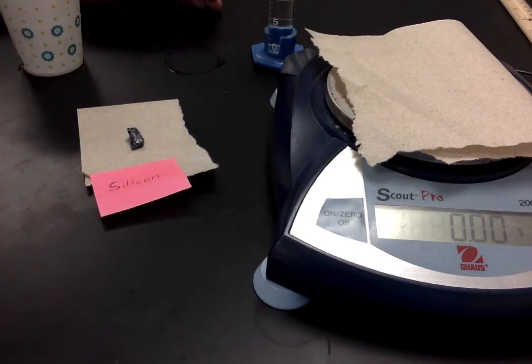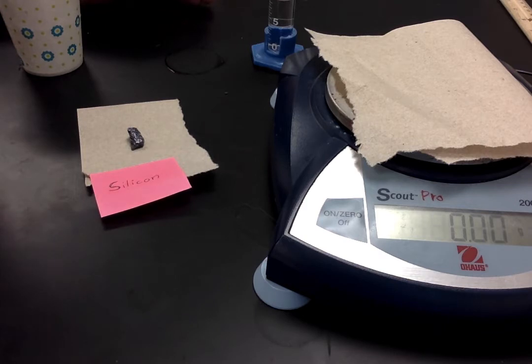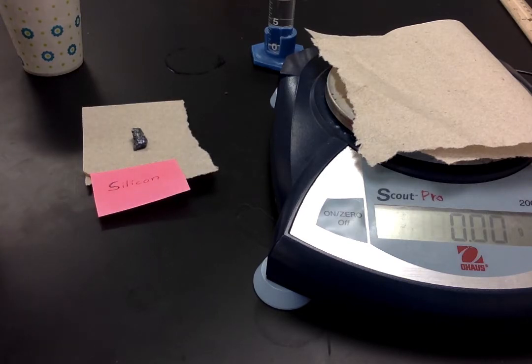Okay. And so right now this graduated cylinder is at 15.9, 15.9 milliliters.